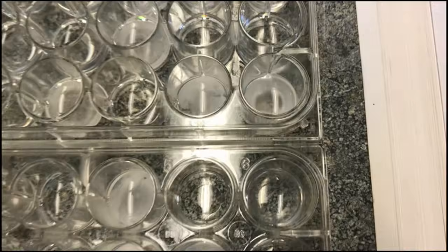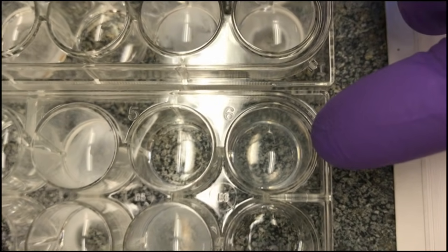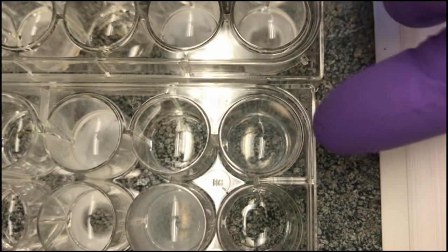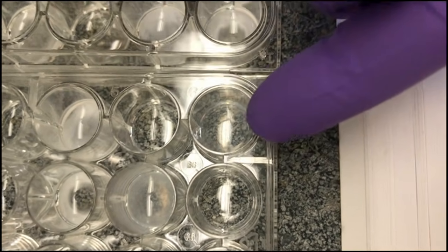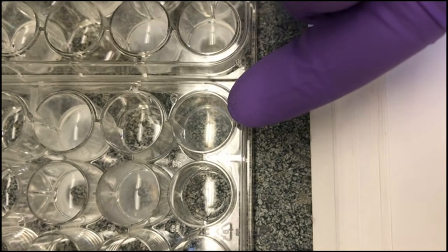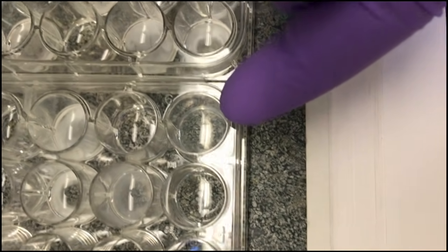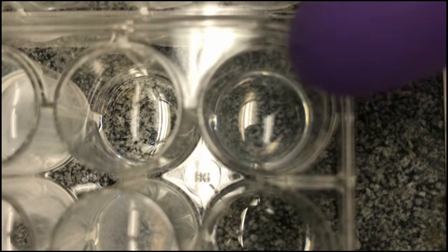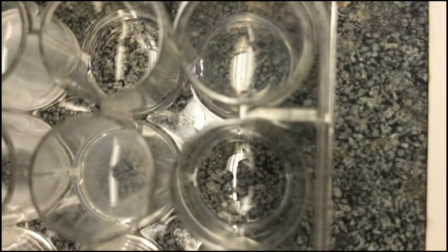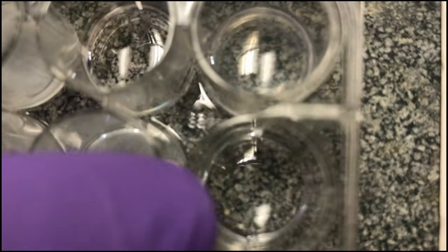And then in this well, it was actually the same two solutions, however, I may have added less to this well than the other well, so it's slightly harder to see, but in person we can see very few milky white wisps or whatever particulate is in the solution. Like right here in the video, look at it in comparison with the one next to it, which has no reaction.